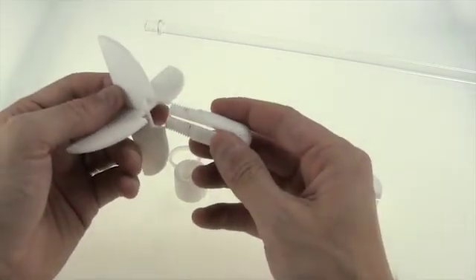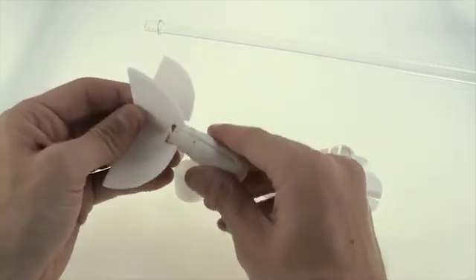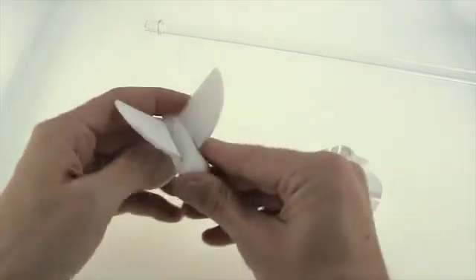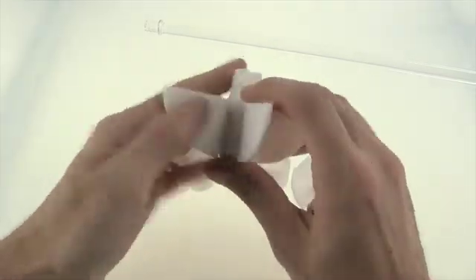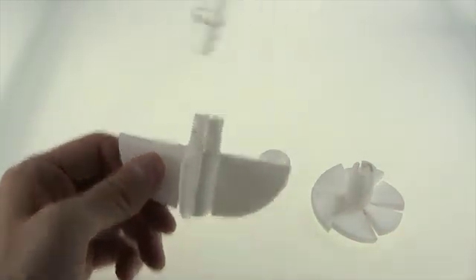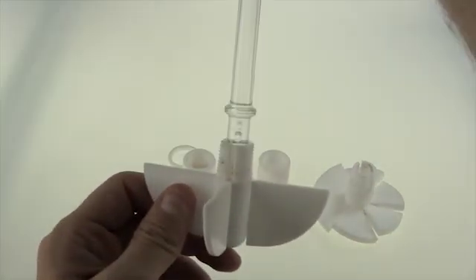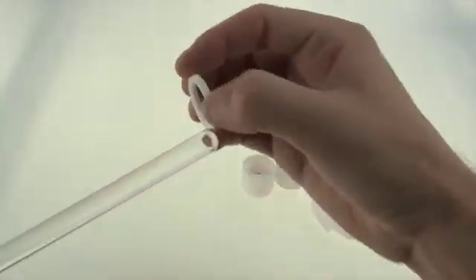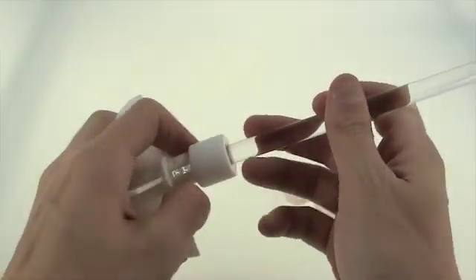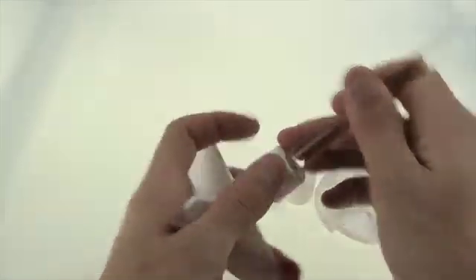Next, stick it into the thread with the thin flat side facing down. Then insert the stir shaft into the thread. Be aware of the two beads at the bottom of the stir shaft — they go in between the sides of the agitator's head. Then, from the top, insert the PTFE ring and then the screw cap.